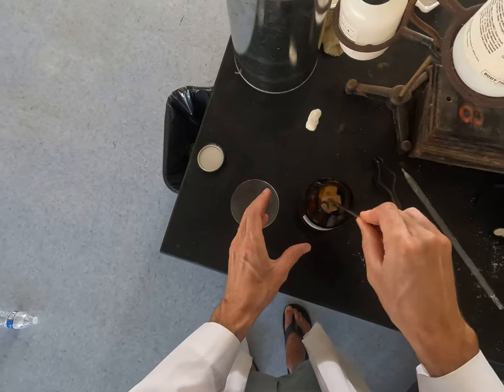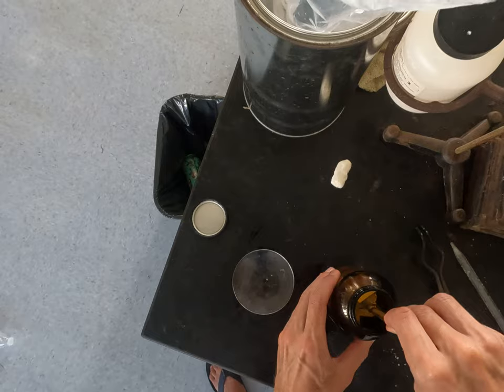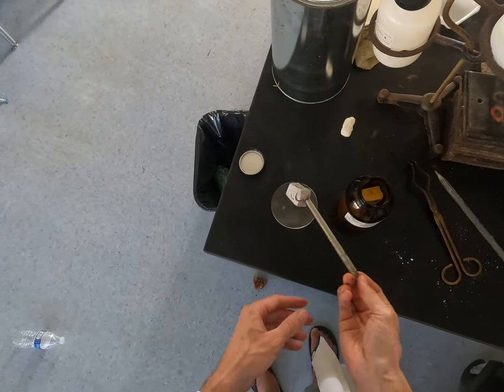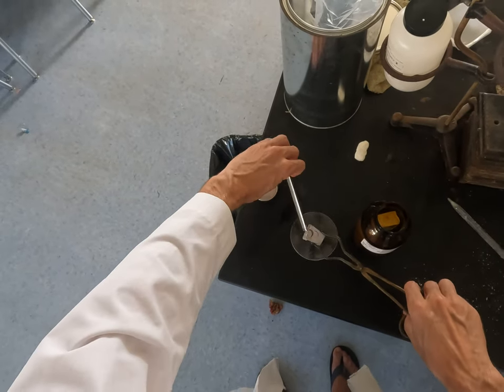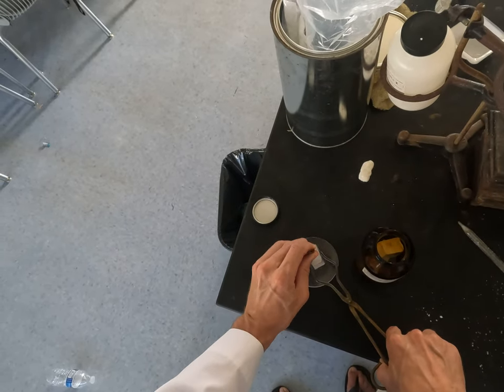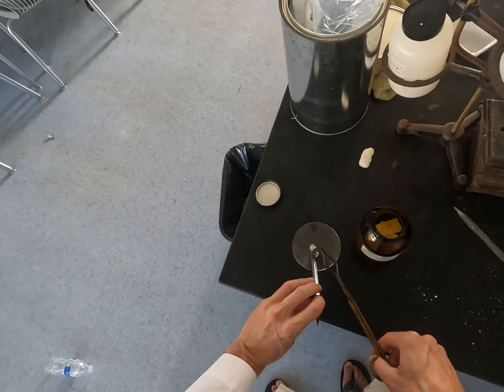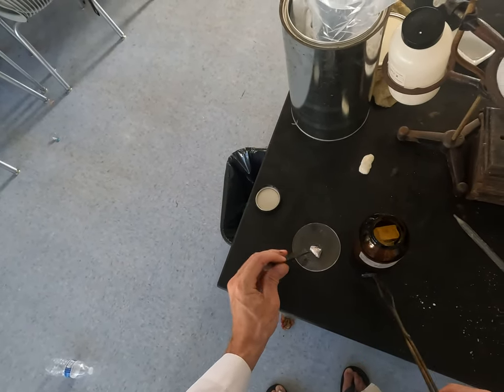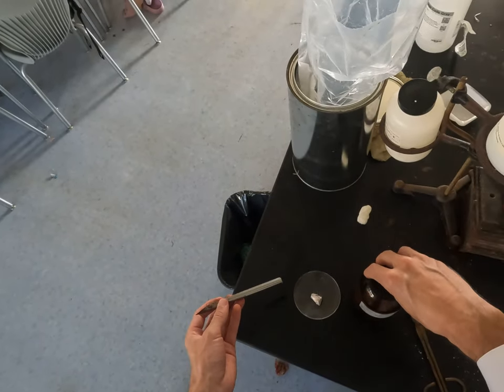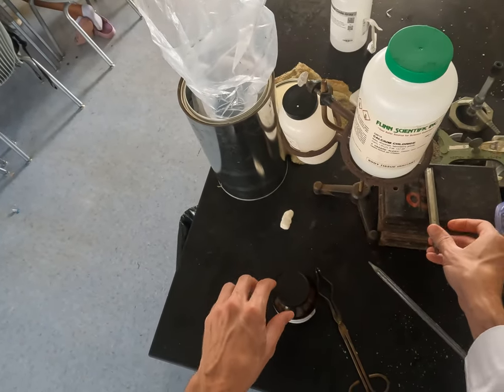I'm just going to stab this whole thing. We're not going to use this whole thing — yes, forbidden tofu. That goes back in the jar. And in a similar way, it's very soft, very reactive with the atmosphere, and forms that nice oxide layer that we saw earlier with the potassium.